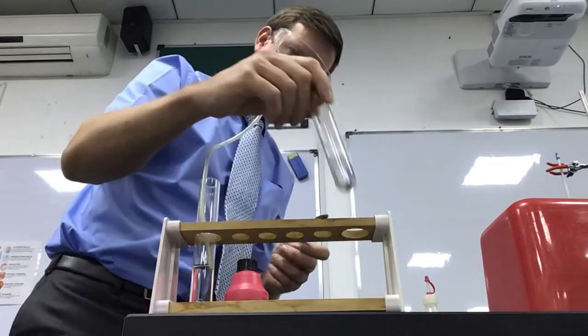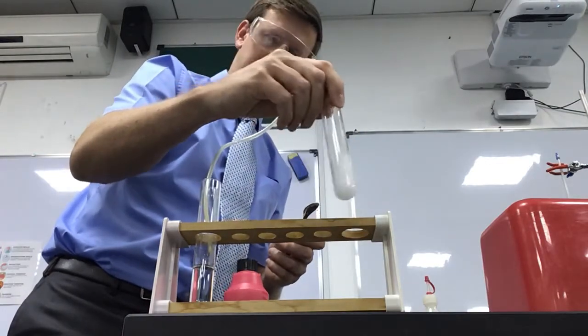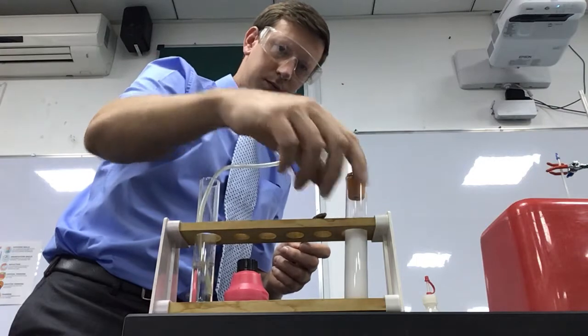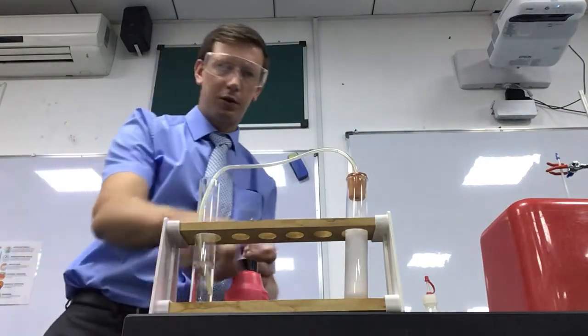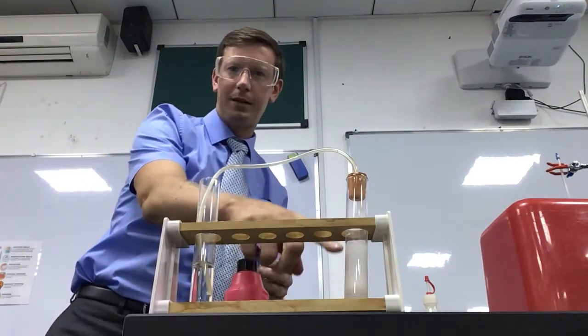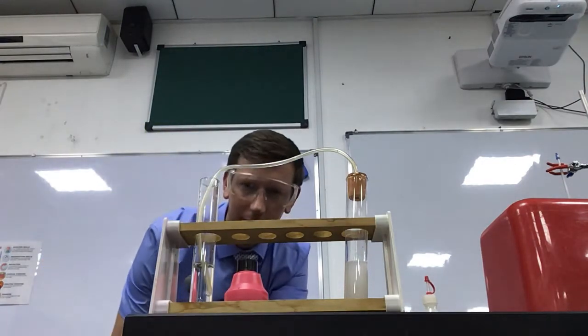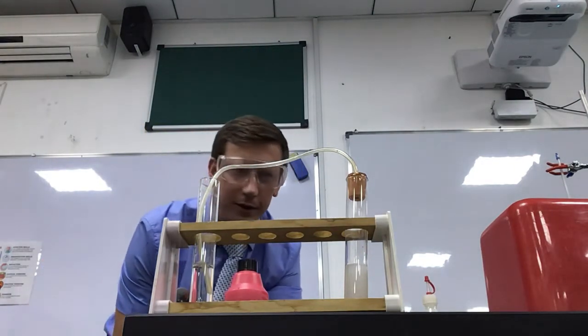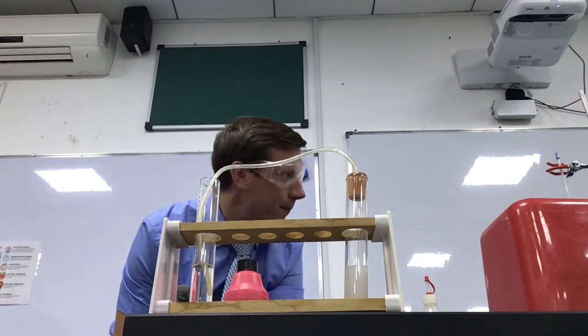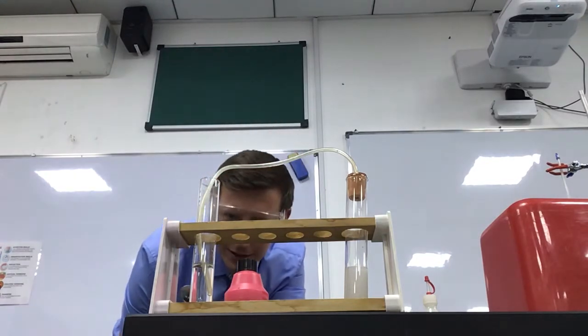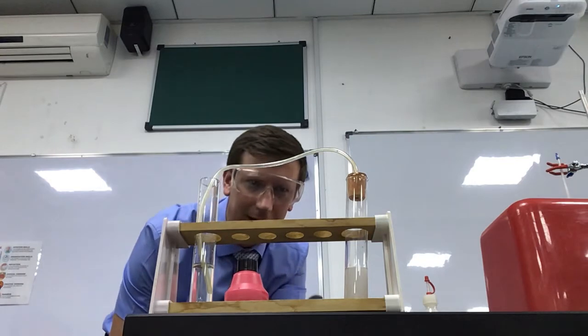Just going to give it a little swirl to get the reaction going. We can see the bubbles coming through. We can see the bubbling up taking place as the reaction happens. I don't know if it's visible on the video. I don't think it's very clear. But it has turned ever so slightly cloudy.